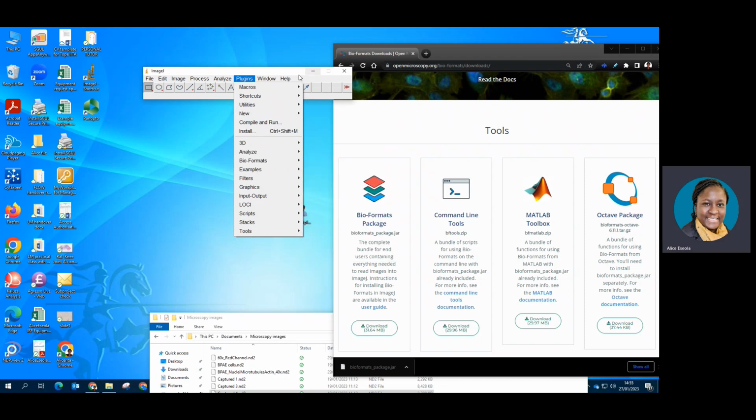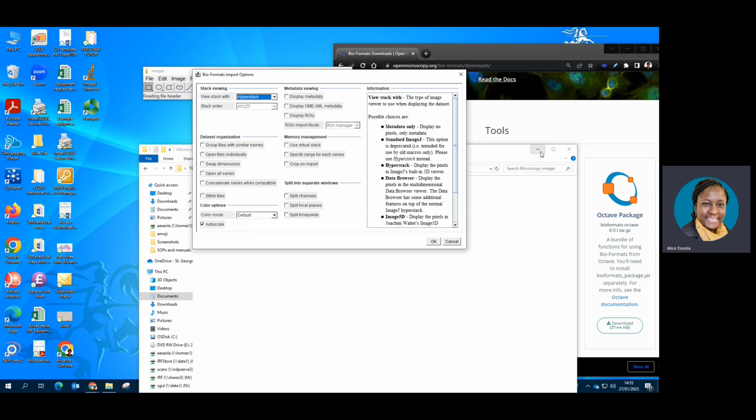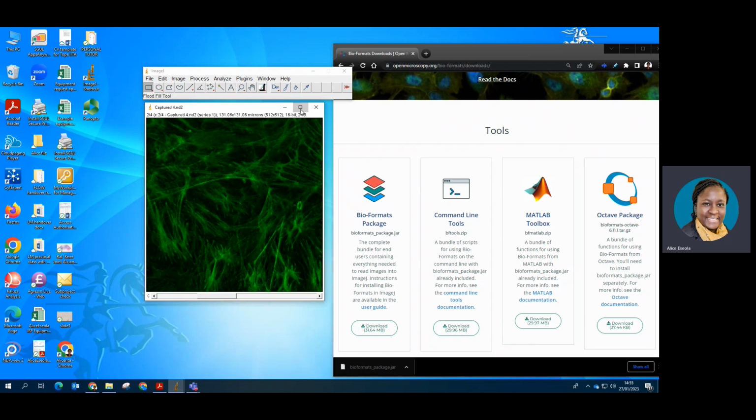plugin. And now if I try repeating to open the Nikon microscope image .nd2, if I drag it here, you can see that it automatically opened the file, which it couldn't open earlier when I tried to open it.